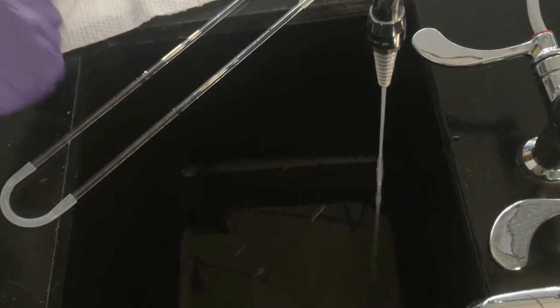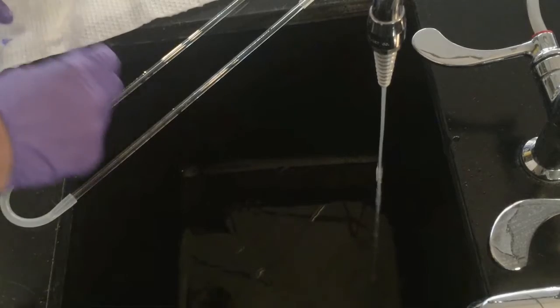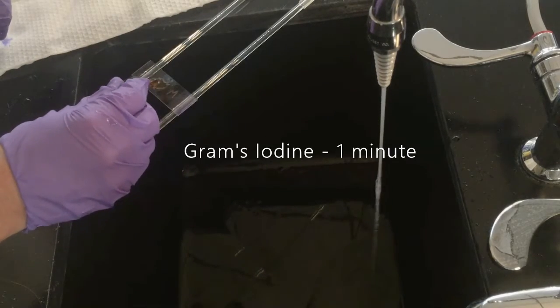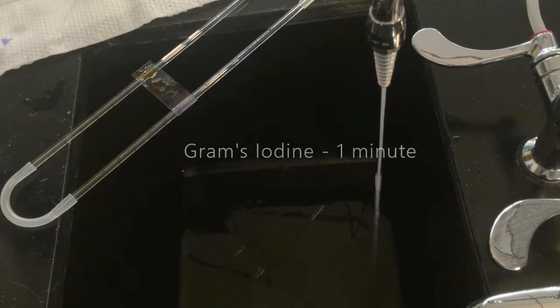Once I'm done, I can dry it off on a piece of paper towel by just tapping it, and I'm ready for the next step. I'm going to add the iodine onto the bacteria and let it sit for one minute.